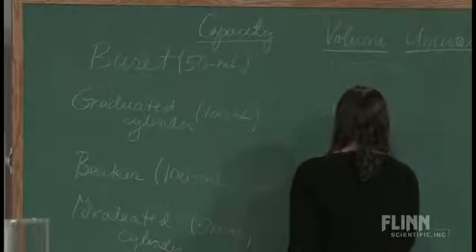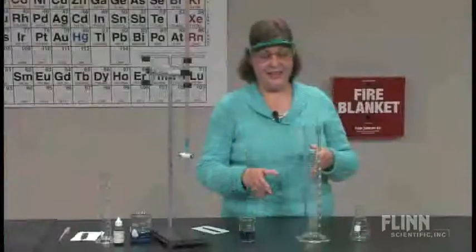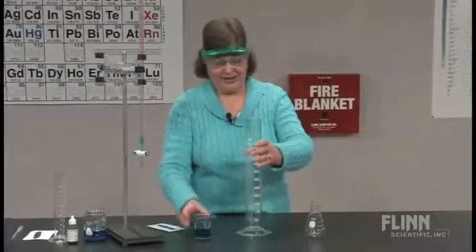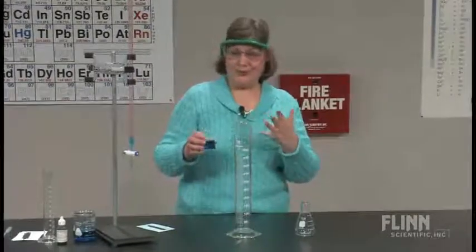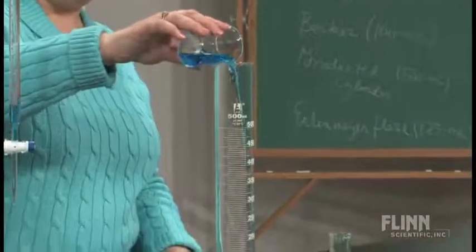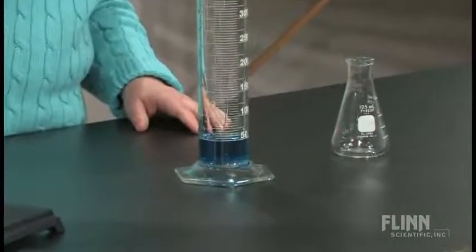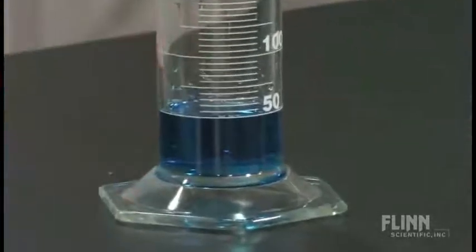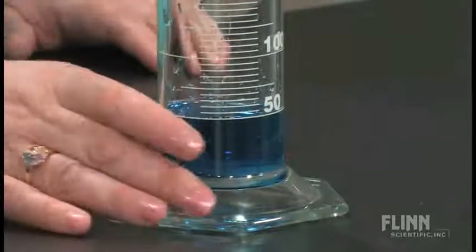Boy, it looks like we're making more volume, doesn't it? Okay, you can kind of get the idea here. We're going to go from the beaker into this large graduated cylinder. And again, if you'll first try to focus on the level after I pour it, and then once you can see that, I'll turn it around so that I can see it. And again, I'm going to pour all of that, try to get those last couple of drops so that we model good technique here. Okay. And you can see that it's taking a little bit of time.